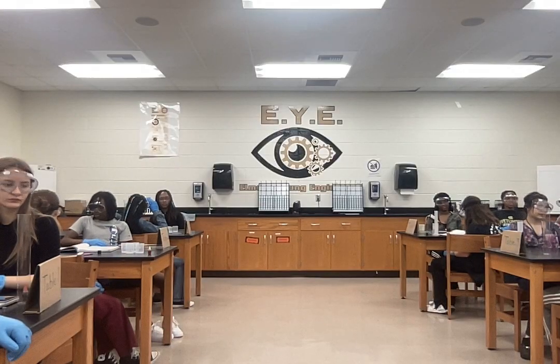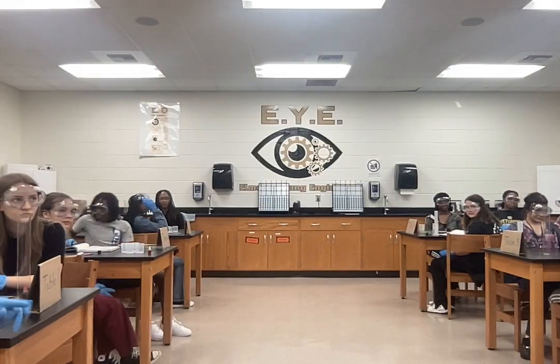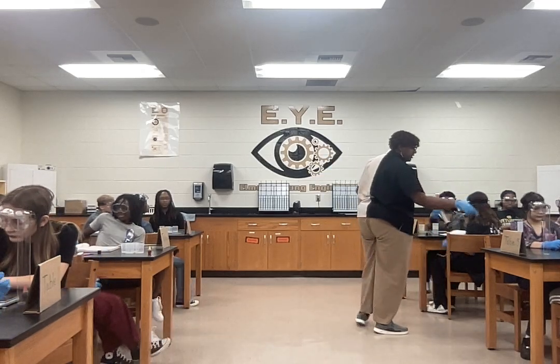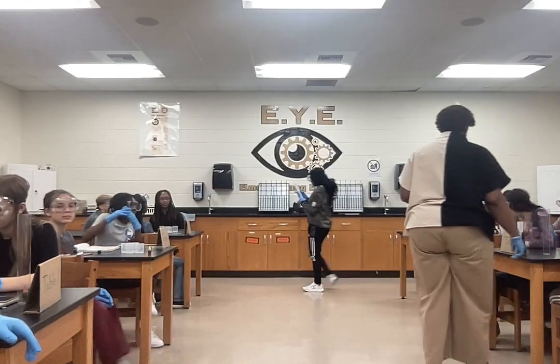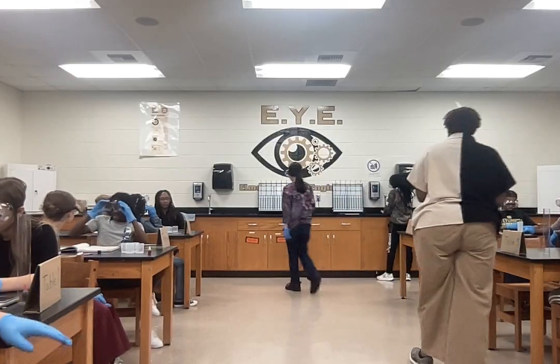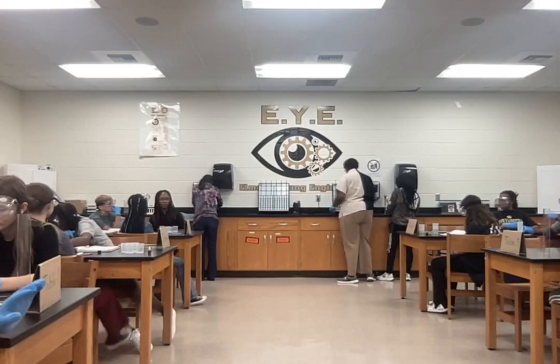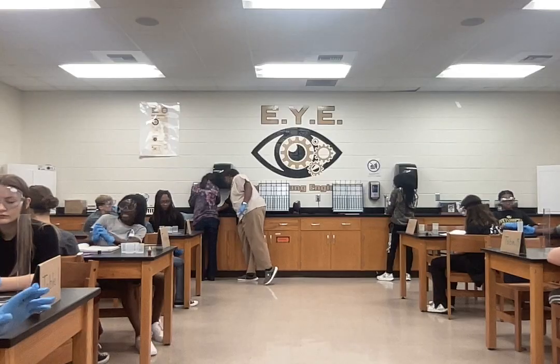All right, so once you have your 25 milliliters, you can have a seat. All right, table 4 can go ahead and get water. And then table 5, take one of your graduated cylinders and go to that sink. You need help turning it on? Alright. So pour a lot of that out, because you only want it at the 25 mark, okay?